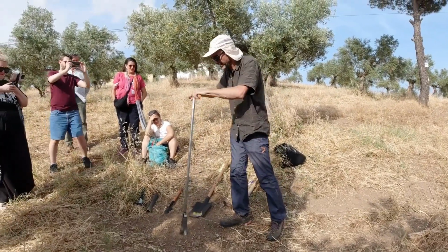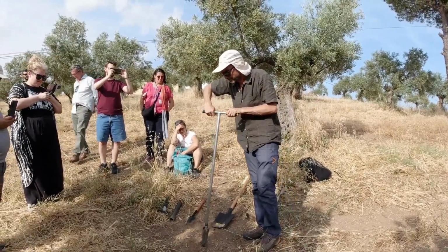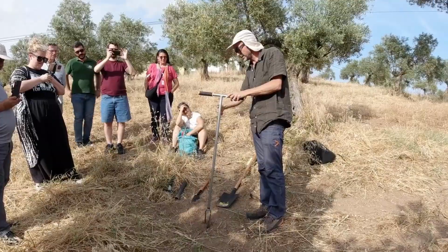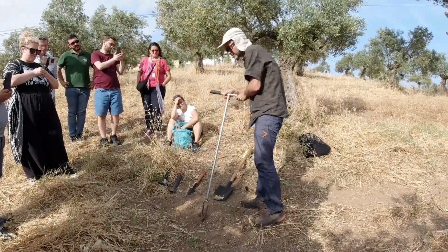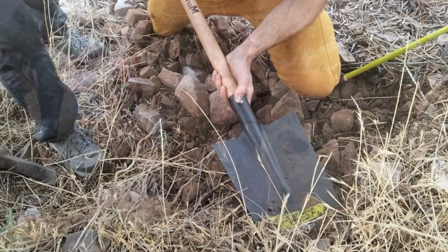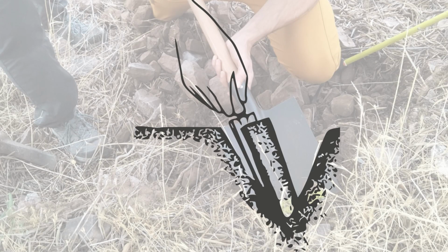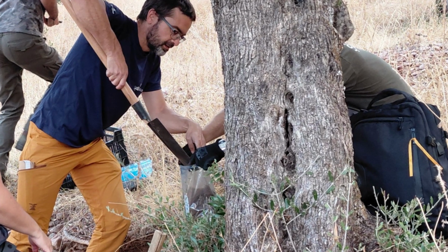Keep the auger vertical at 90 degrees to the ground. Drive the auger to the 10 centimeters mark. Withdraw the tool and transfer the soil to the compositing bucket or clean plastic bag. If you are using a spade, cut a V-shaped hole, then slice an approximate 3 centimeters thick slab from one side. Trim to keep the middle 3 centimeters, and place that soil into the bag.